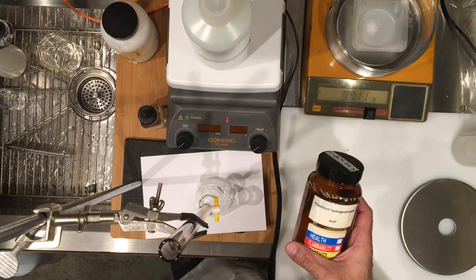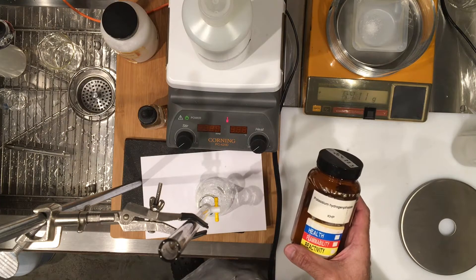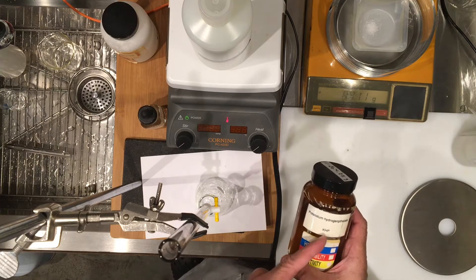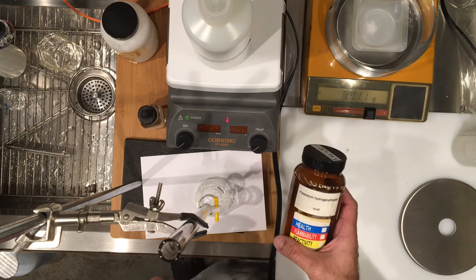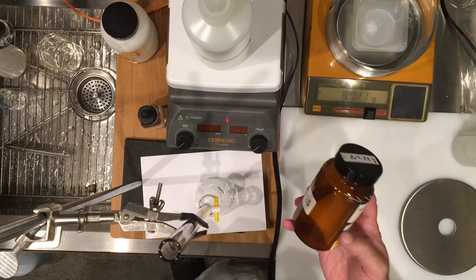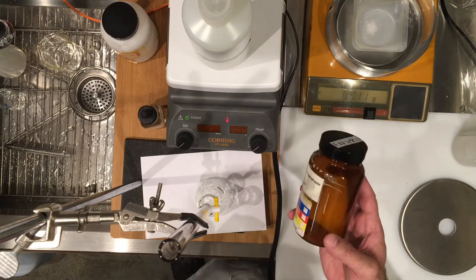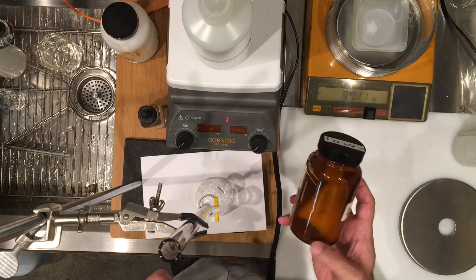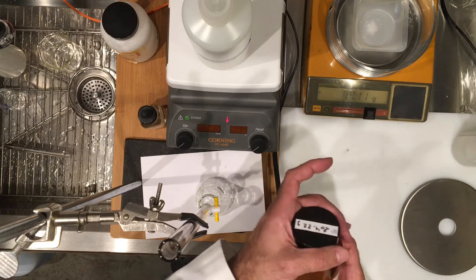It is an acid anion salt of potassium and it has one hydrogen that would be neutralized with sodium hydroxide. This substance is very stable. It's a powder that does not absorb moisture and it can last for many years if you keep the container closed.